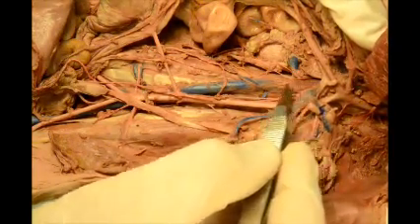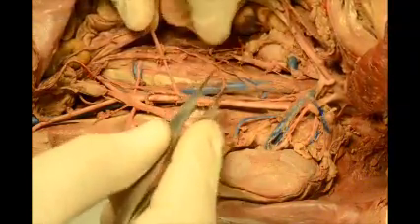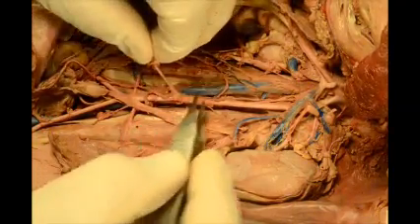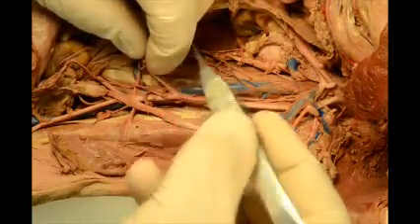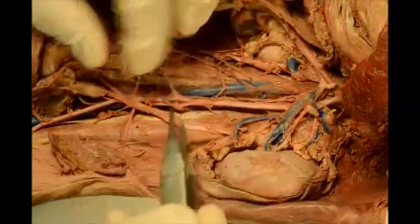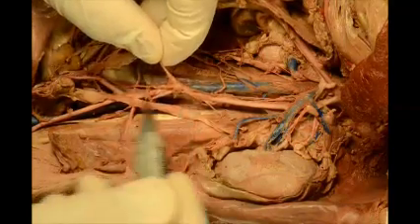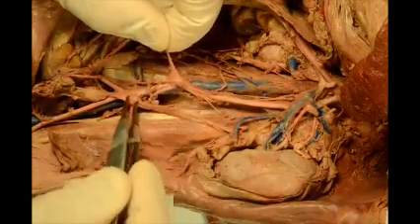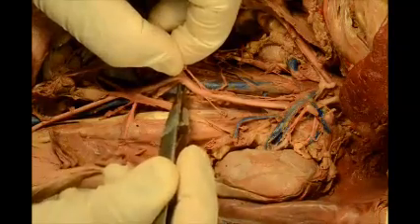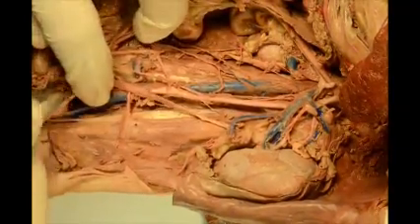As we go downwards, you will see the branches. It goes underneath the artery, but I used this cat to explain the arteries as well, so I didn't cut away the artery. So the abdominal vein continues downward, and again, it forks.